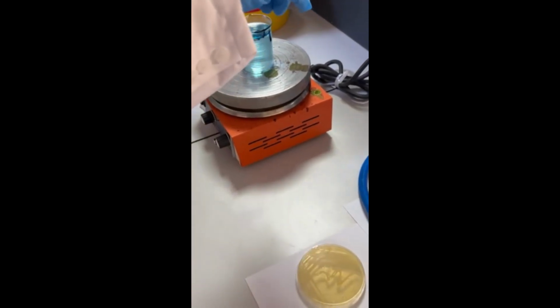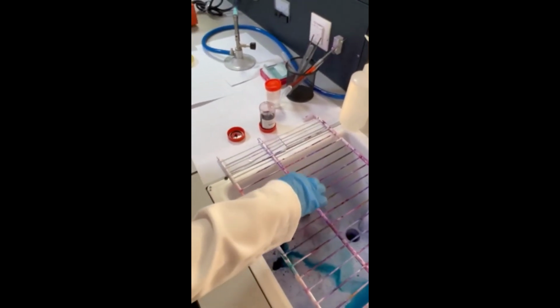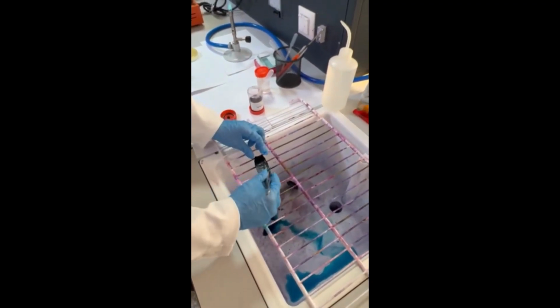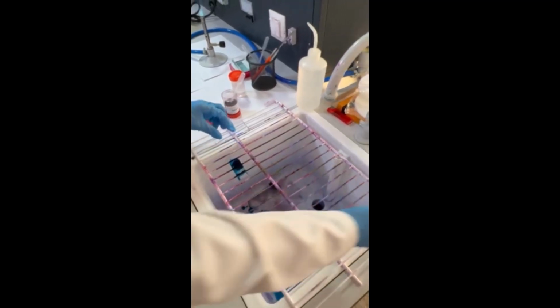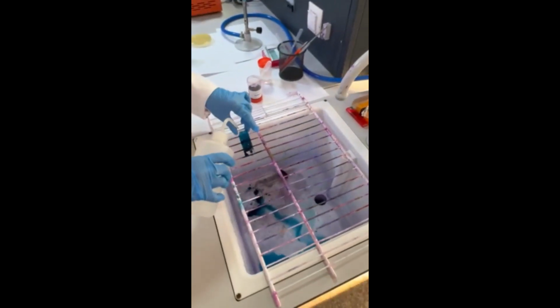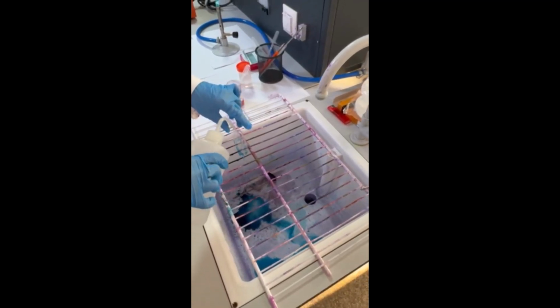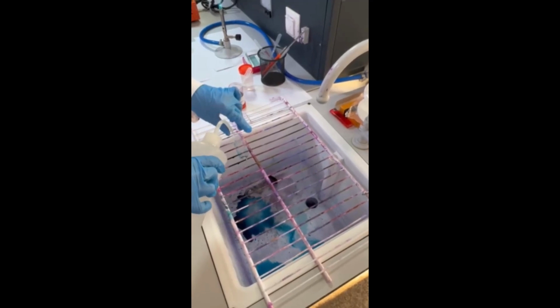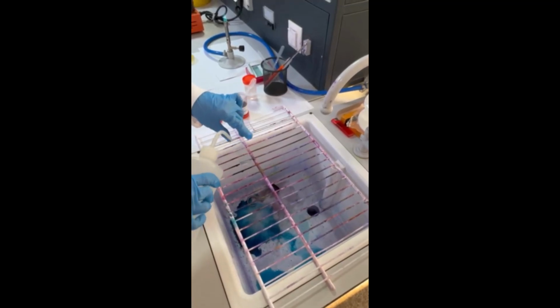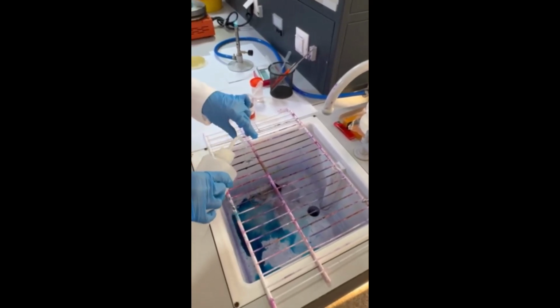After 5 minutes, first I allow the slide to cool. Remove the filter paper and wash with distilled water. During this step, the water acts like a decolorizer. It removes the malachite green from all bacteria, while the spore will retain the primary stain. Here I wash for about 20 seconds.